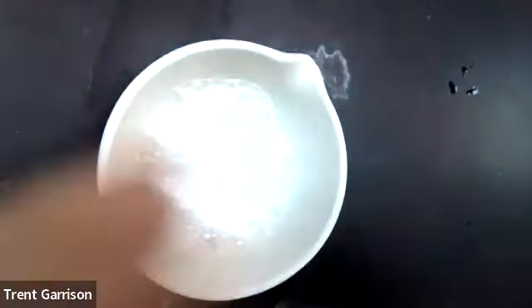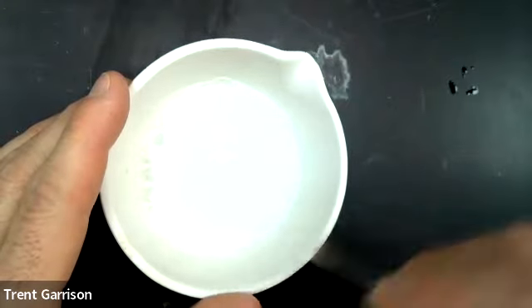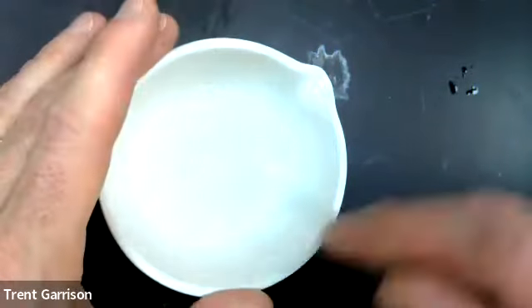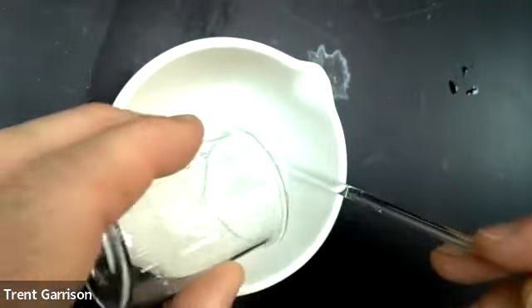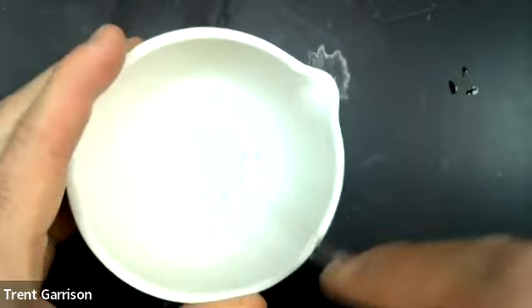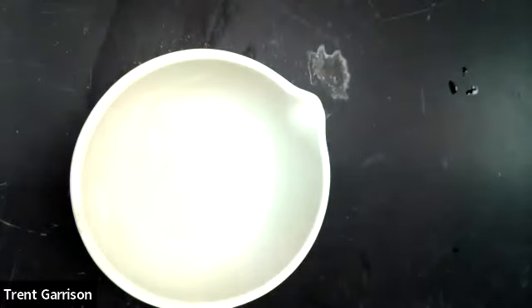I'm going to do some stirring here to make sure all of that baking soda gets in contact with our vinegar so that we have a perfect reaction. Now, part of the error of this is that you can feel that little bits of the bubbles have carried away probably some of our product in the process. So I'm going to add a little bit more vinegar here, but it appears that my reaction has pretty well occurred, because after adding a little bit more vinegar, there's no more sizzling anywhere that I go here. So it looks like I've pretty much caused the completion of the reaction.